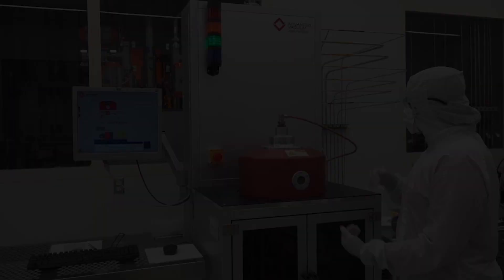In this video, Aaditi will demonstrate the operation of the Plasma Enhanced Chemical Vapor Deposition System, or as we say, PECVD. This fabrication tool is located inside the clean room, so let's get into our clean room suits and take a look at the PECVD system.